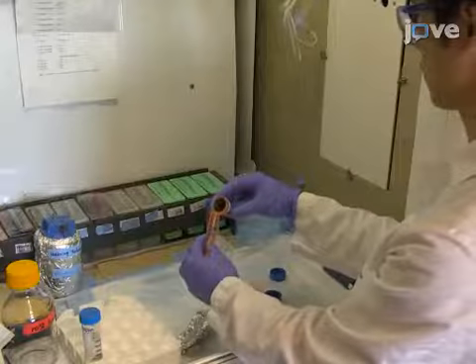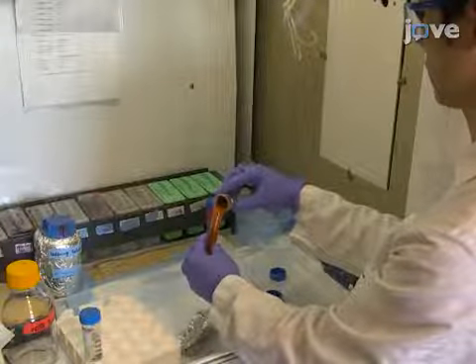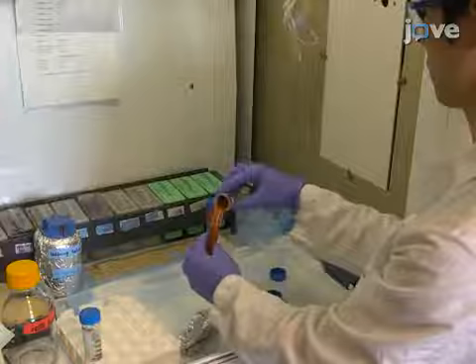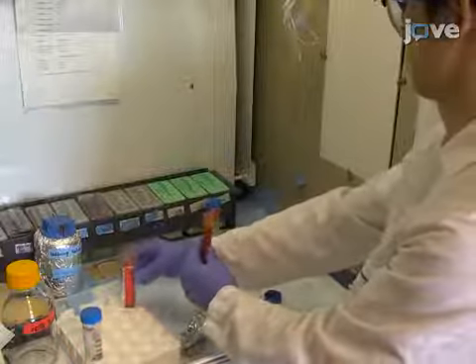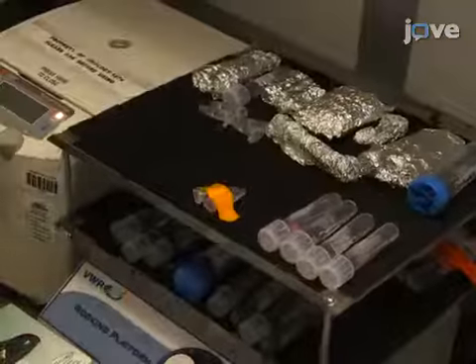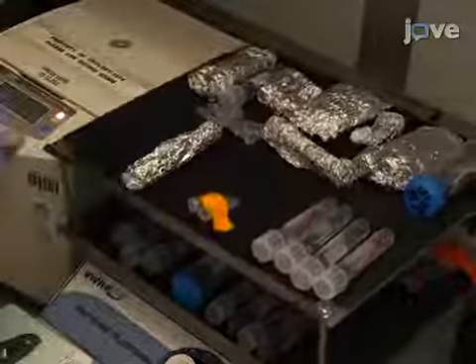The next morning, immerse the sample in a one-to-one volume-to-volume mixture of freshly prepared infiltration and staining solutions for at least three hours on a rocker at four degrees Celsius.